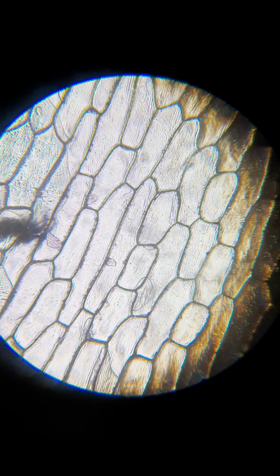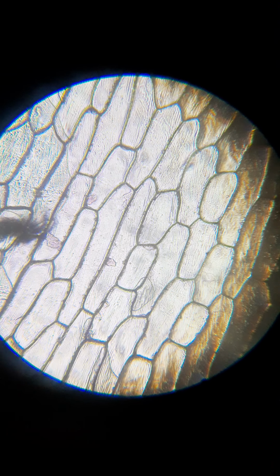Because this is a plant, I can't show you a hypotonic situation where the cells will explode, because the cell walls are going to protect that from happening. But I can show you a hypertonic situation. I just want to show you what it is, and then after I do it, I'll take you to the board and I can explain what's happening and how it applies to certain parts of the body.